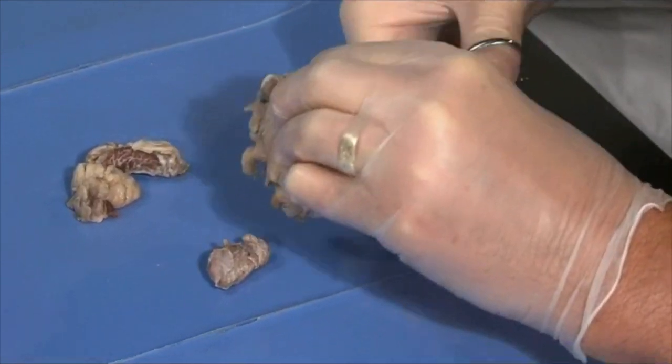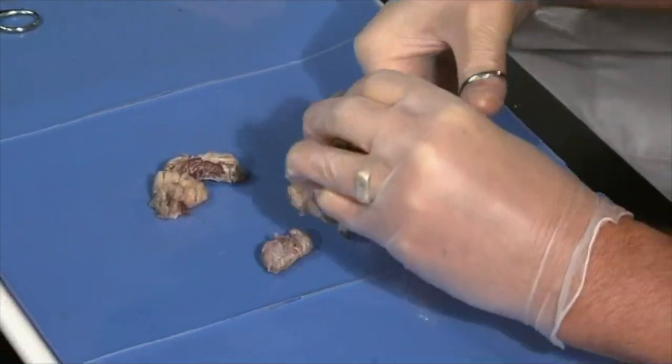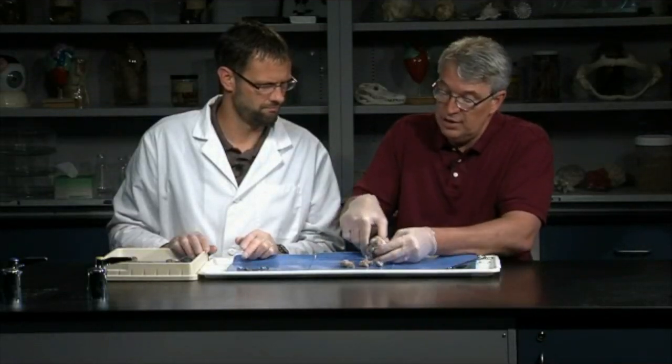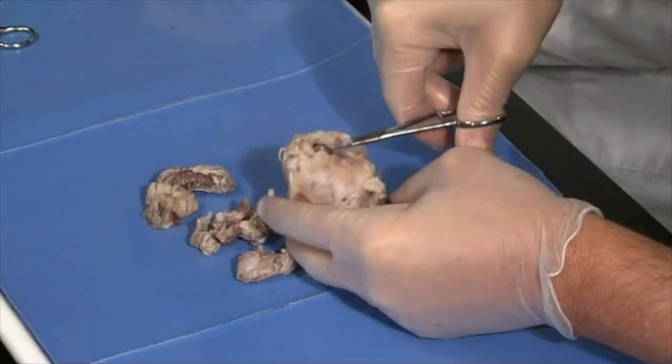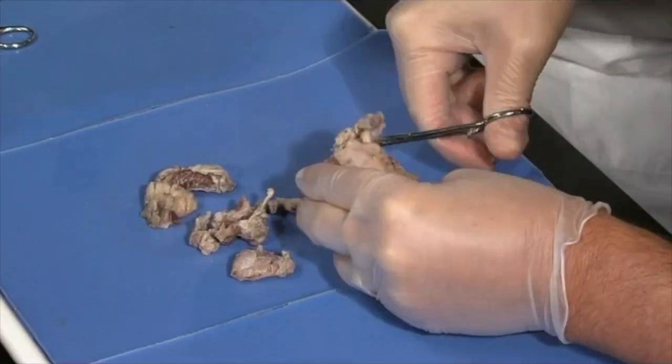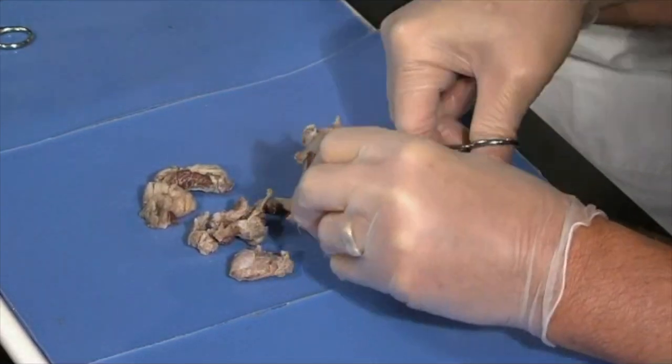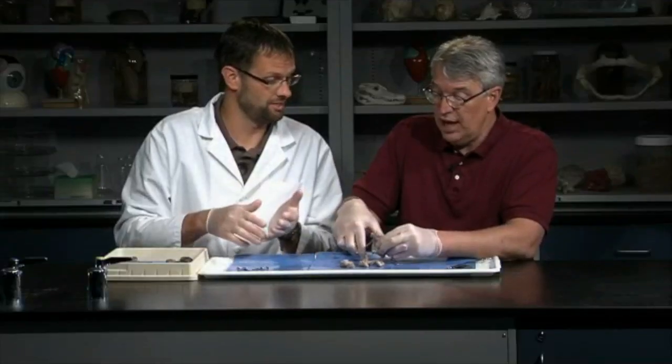There isn't too much to damage here as long as you don't go into the eyeball itself. Just trim away, and be careful around the optic nerve. It's nice to be able to preserve the optic nerve as we cut that tissue away. There's a lot of fat there. Maybe have all the kids in a group try it to feel the difference between the muscle and the fat. Everybody should have their gloves and be ready to go, and so they could cut. Yeah, and it's pretty dense tissue. It doesn't cut easily sometimes.